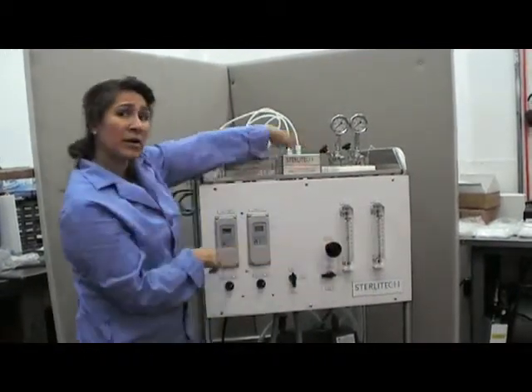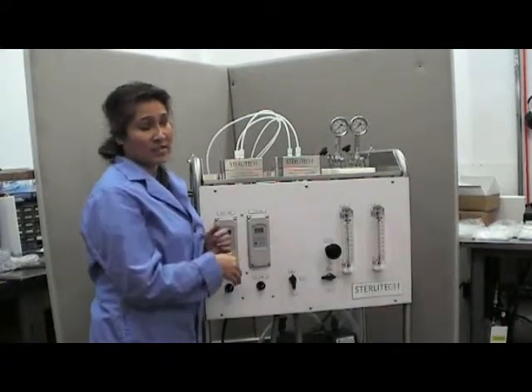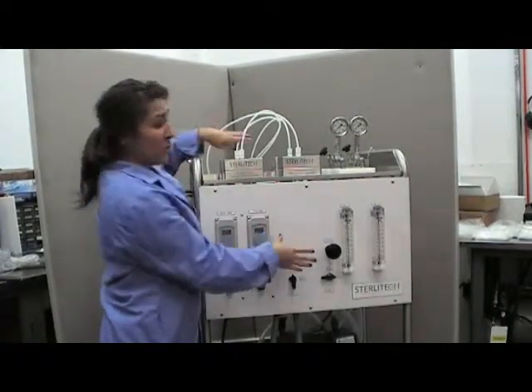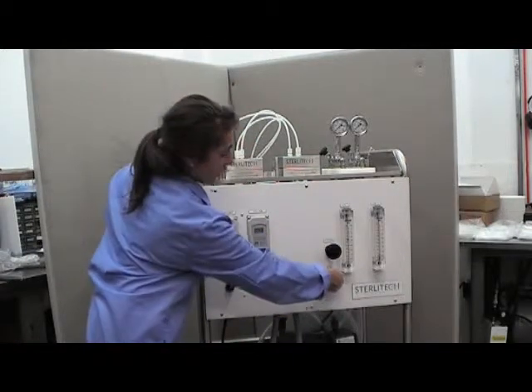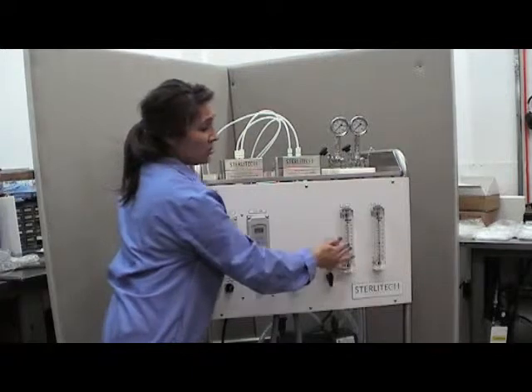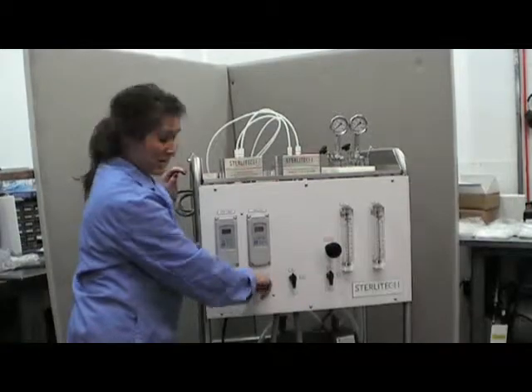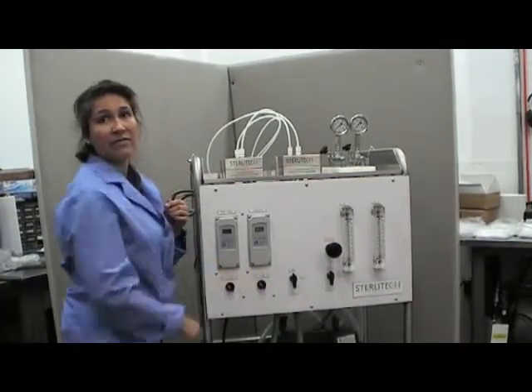If you're done working with the system you'll want to make sure you turn line one or line two back on before shutting the system completely off. So again be sure both valves are fully open. Turn line two back on. You'll know it's on when the two flow meters reach equilibrium. And then you can begin to turn off the pump and then power the system off.